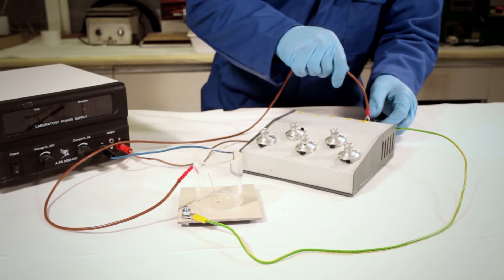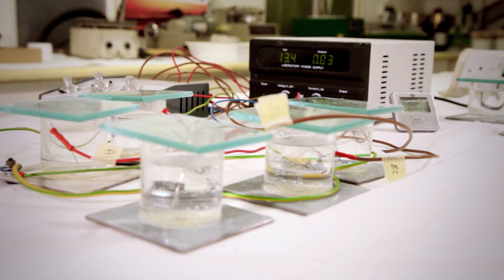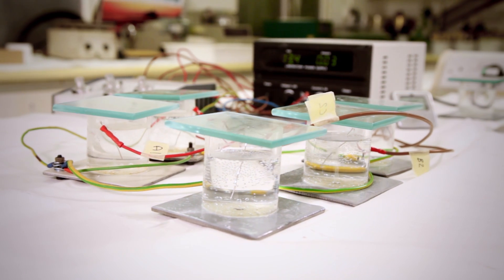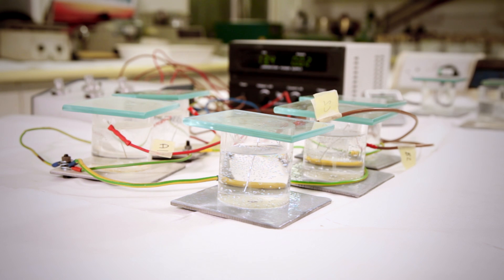The test panel and anode are attached to the cell controller terminals. The cell controller is capable of maintaining the electrode potential of the test substrate at the specified voltage.